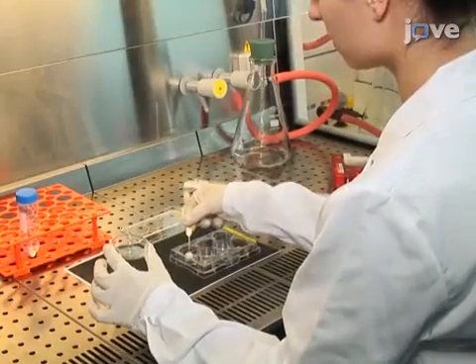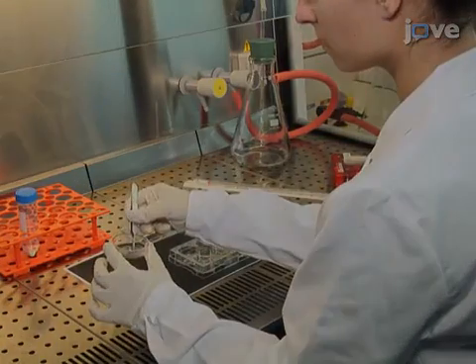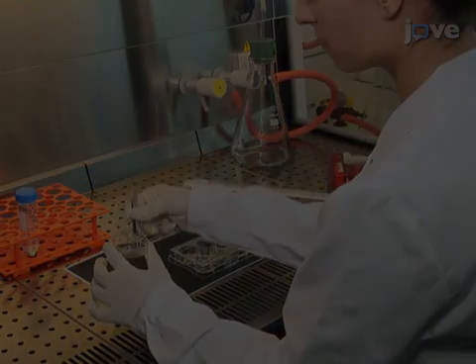To prepare neuronal cultures, place glass coverslips into six well-culture dishes.